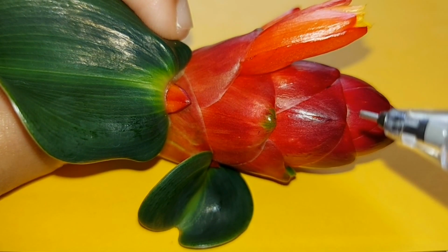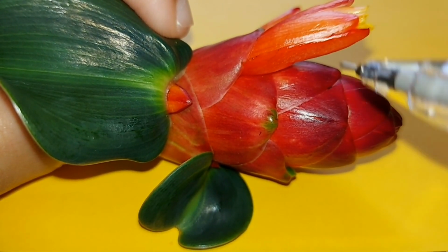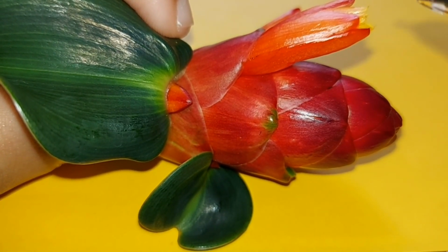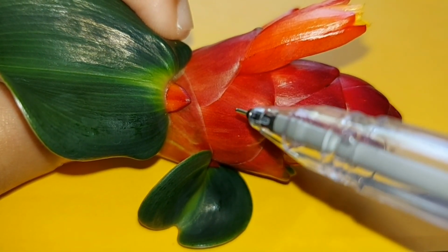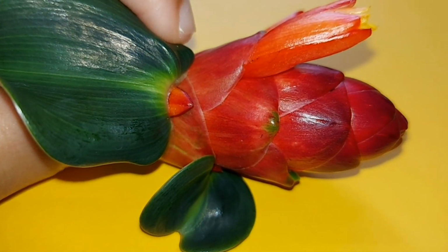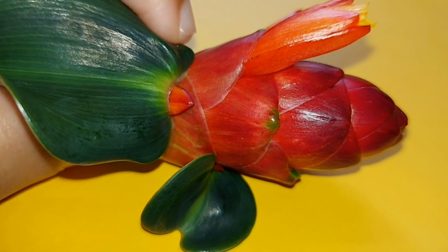Now what I will do here is I will take out an individual flower, this one. I will dissect the flower and show you the parts, the petals, the filament, the sepal, and whatnot. And then I will also dissect this unbloomed bud here and show you how the flower which is not bloomed yet looks like.